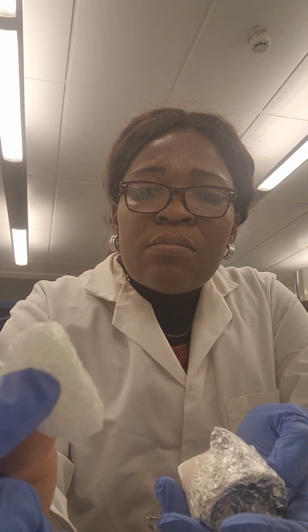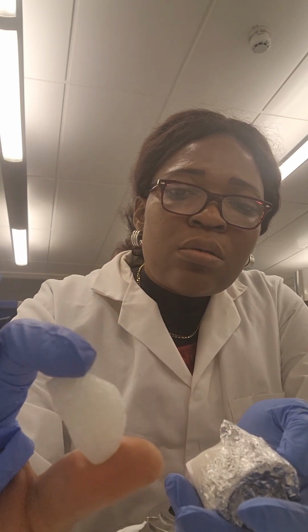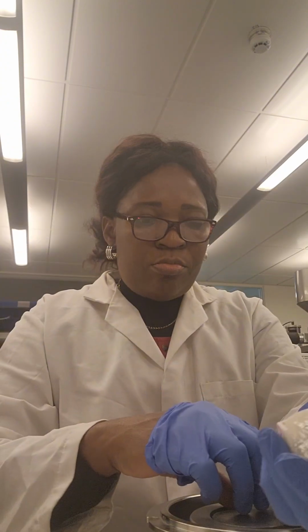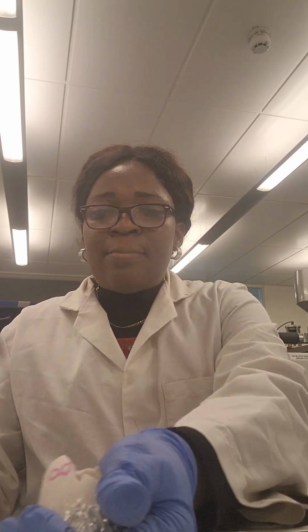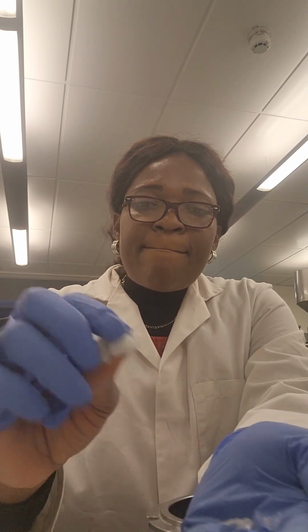So this is at 1200 degrees Celsius. Wow, it really looks glassy. Wow, you see that beautiful thing? So at 1200, of course, you should expect kind of full melting, but that doesn't mean the melting temperature of silica has been reached, but because there is flux and formation of eutectics, you could expect a kind of full melting at this time, but not full fining.